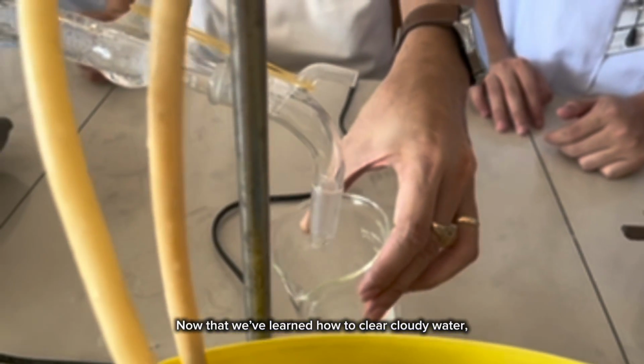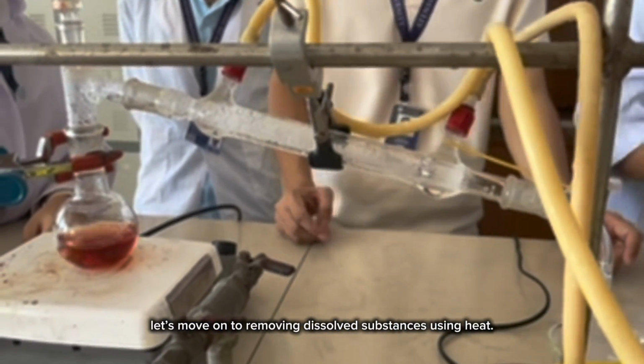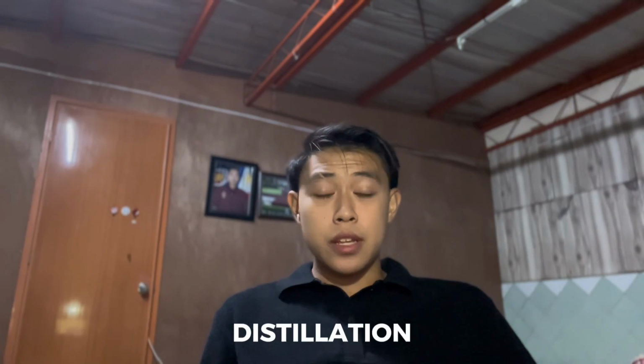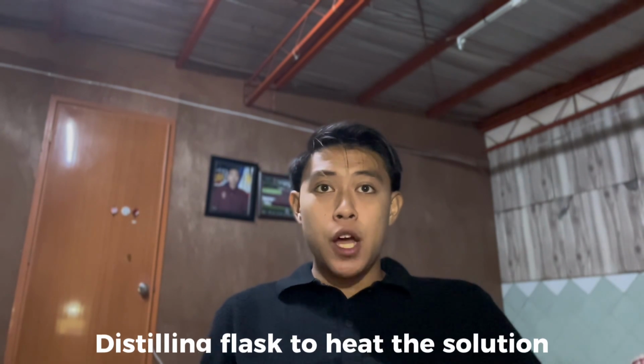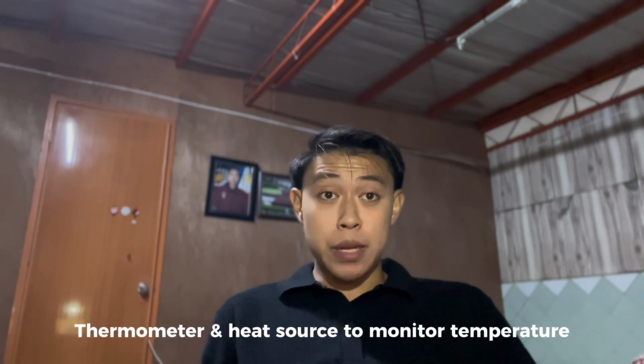Now that we've learned how to clear cloudy water, let's move on to removing dissolved substances using heat. So what's the next method? Distillation. It separates substances based on boiling points. Here's our setup. We have distilling flasks to heat the solution, condensers to cool vapor, receiving flasks to collect distilled water, and a thermometer and heat source to monitor temperature.